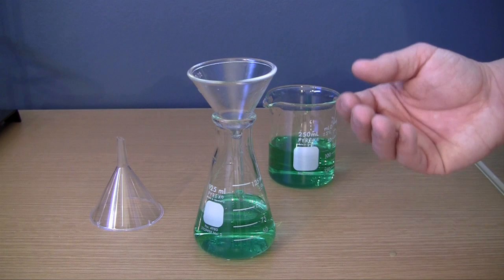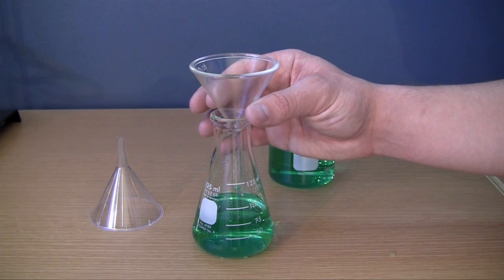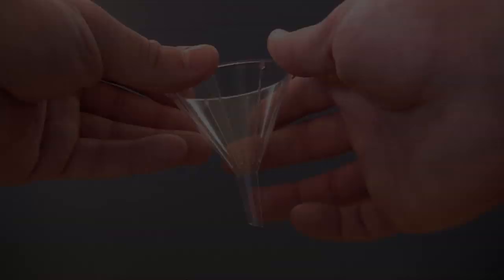So typically what you want to do is you want to lift up this funnel just a little bit and that allows not only air but also the liquid to get in the container.